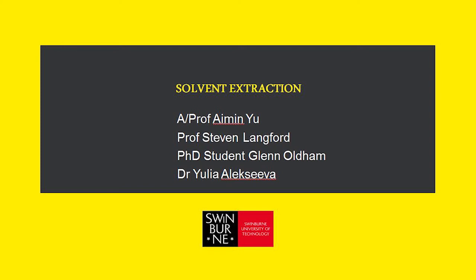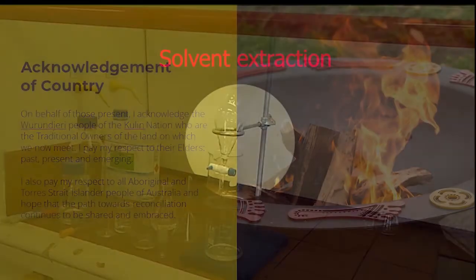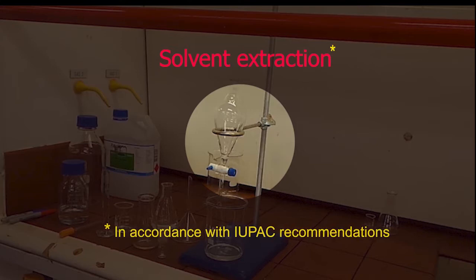Solvent extraction, also known as liquid-liquid extraction, is a separation technique.